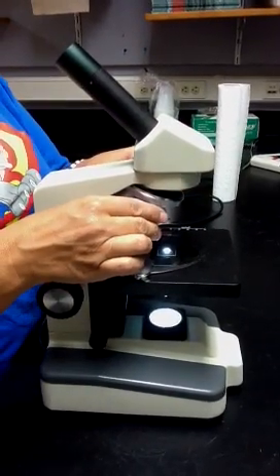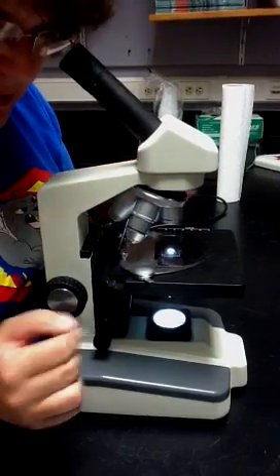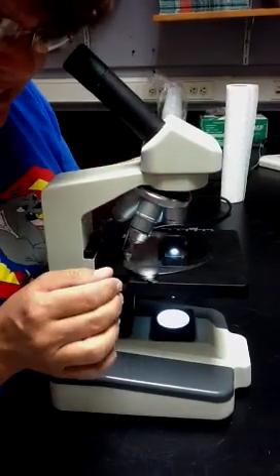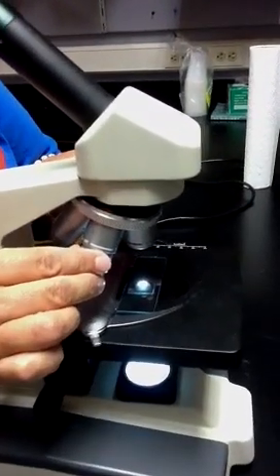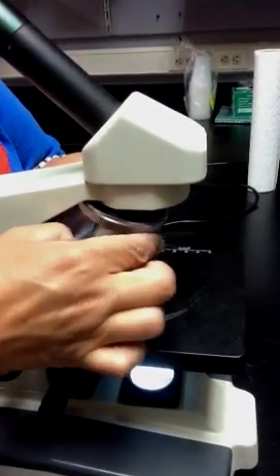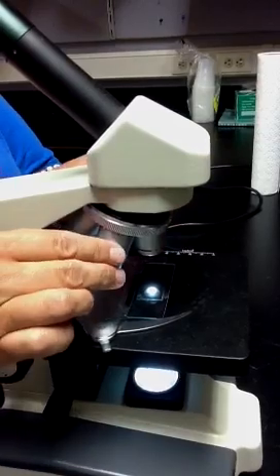A common error is kids will look through the eyepiece and it will be dark, and they'll say, I can't see anything, and it's just a matter of clicking that objective lens into place.